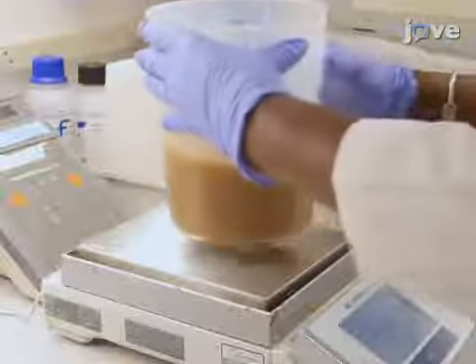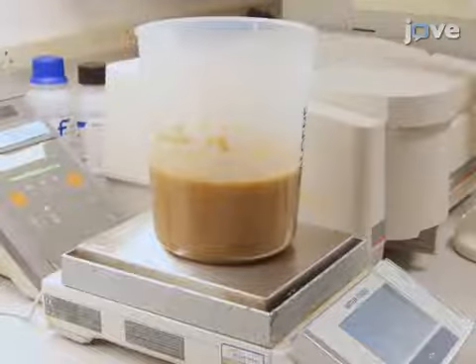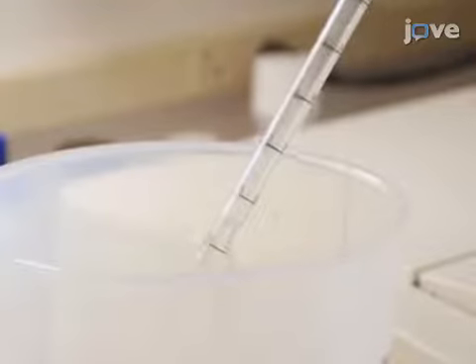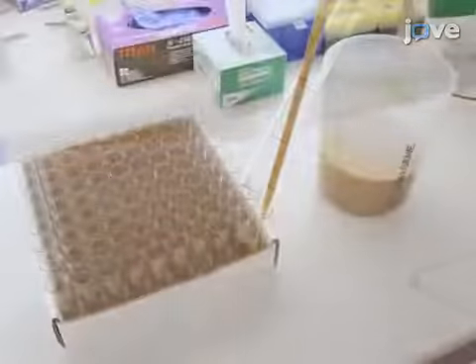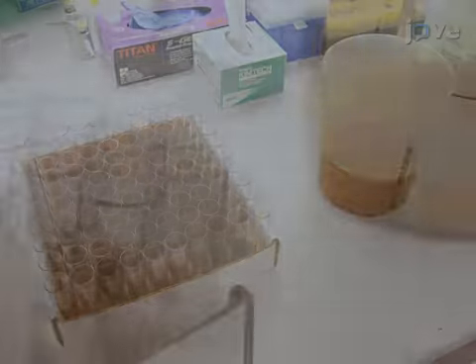Re-weigh the high-fat food. If the total weight is less than 1 kilogram, add about 10 milliliters of water to bring the weight back to 1 kilogram. Next, pour 10 milliliters of the well-mixed high-fat food into each vial.